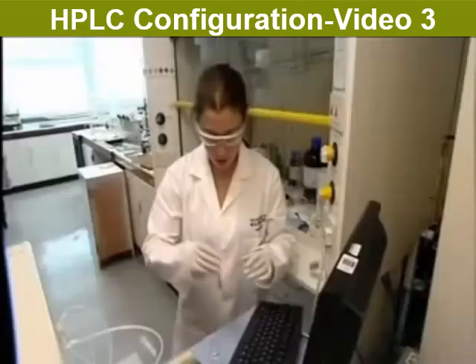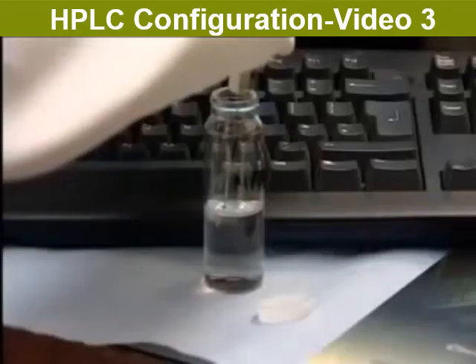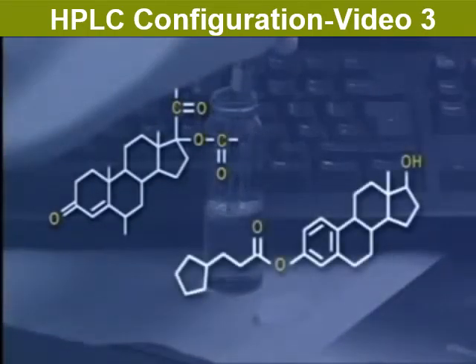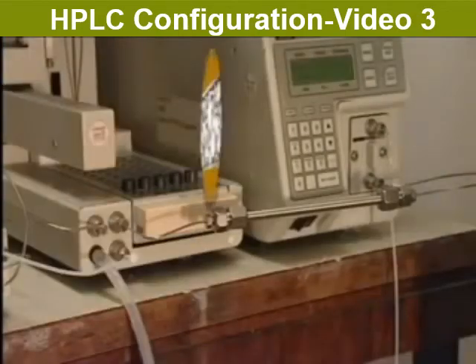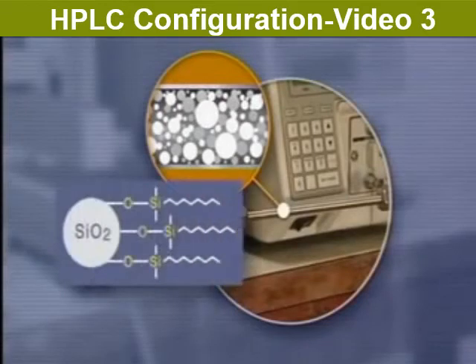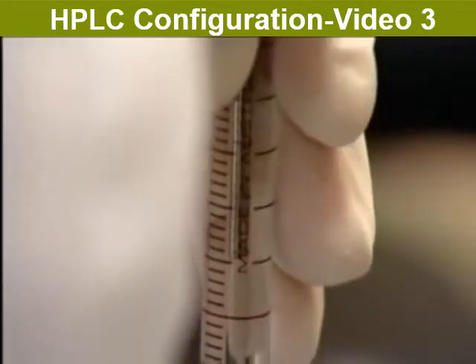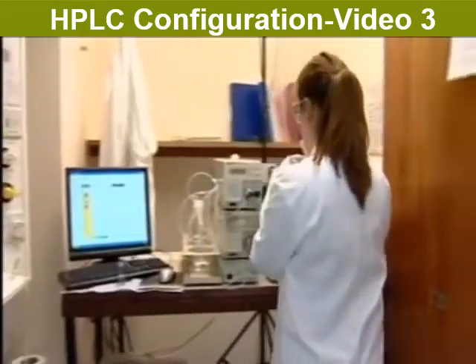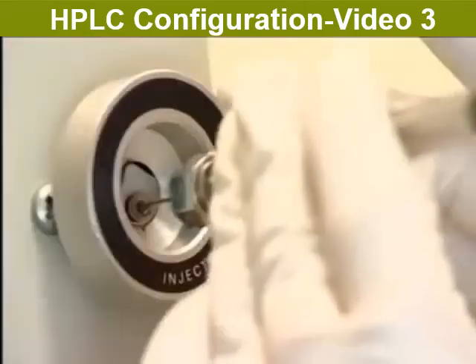Here, the HPLC instrument is being used to separate a mixture of two steroids used in a pharmaceutical preparation. The column chosen is packed with a non-polar solid. The tails of the molecules represent hydrocarbon chains C8H17. Having chosen the solvents, detector wavelength and flow rate, a single sample is run by injecting about 20 microliters into the injection port.